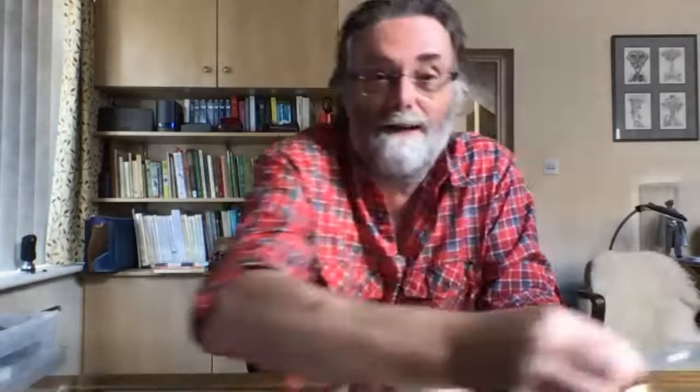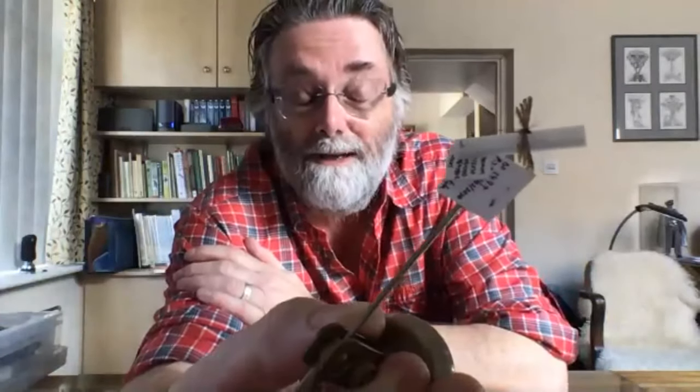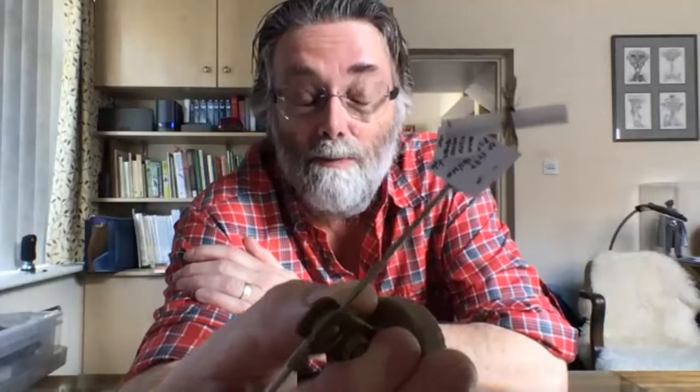Let's start by having a look at a beautifully prepared specimen that I prepared earlier. What I've got is really the perfect way to present your moth specimens to me for dissection — nicely killed, dried, and set.